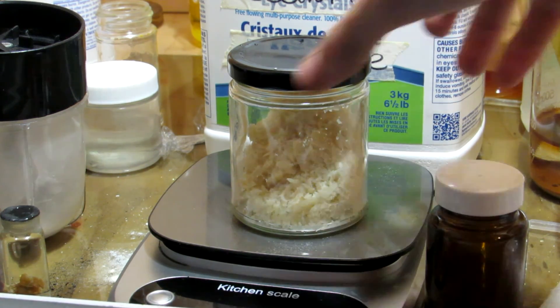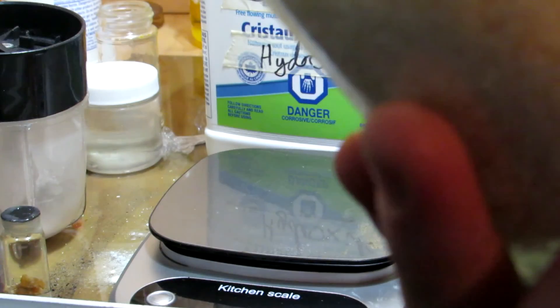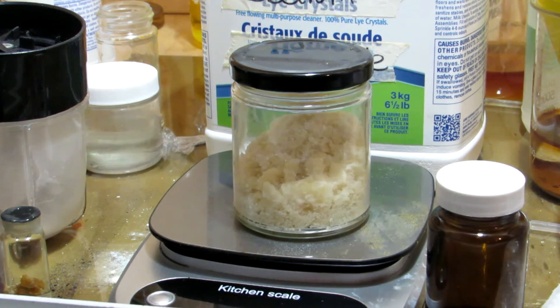This corresponds to approximately a 30% reaction yield, which isn't the best but not too bad. Acetamide can absorb water from the air, so it's important to store it in an airtight container. This is essentially how to make acetamide from household materials — it's fairly easy to do.